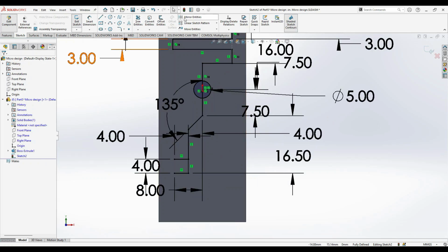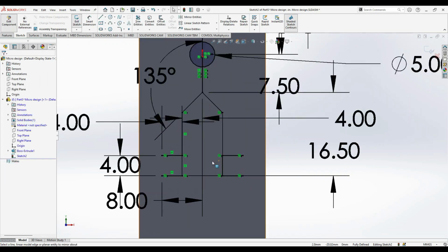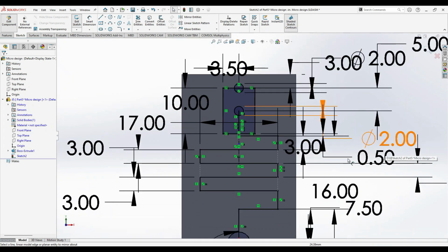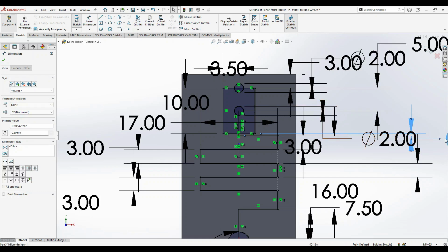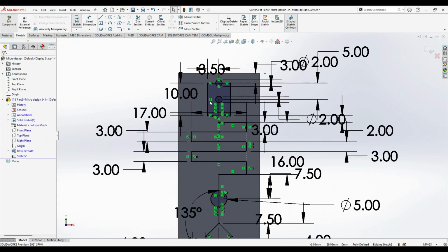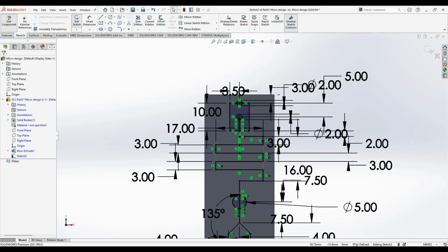Then it is very simple, just create a mirror and cross 1, 2, 3 and 4 lines. Mirror about this axis. Give it a second time. Right, so we have done everything. Now we just have to create, and this we have given is 0.5, so let's increase this. Now everything is set and we are in fully defined case.